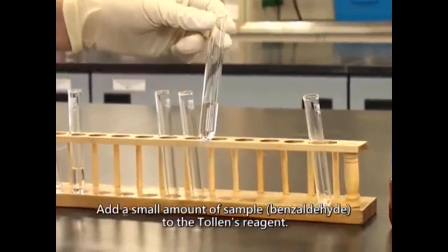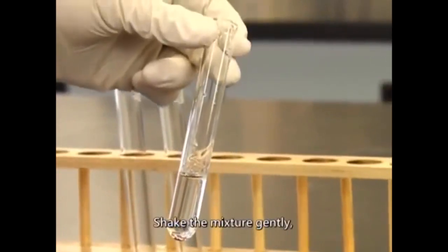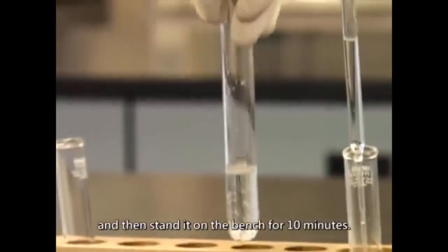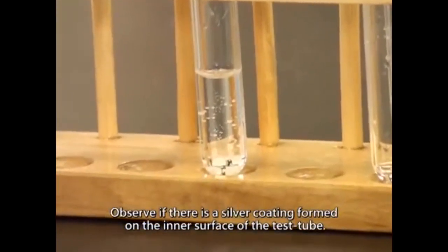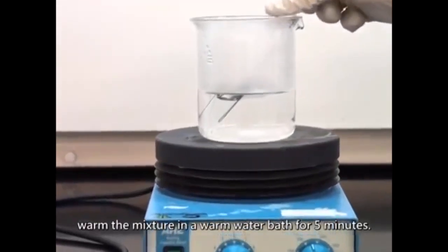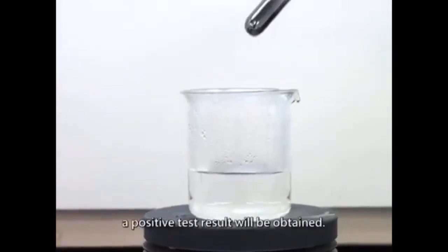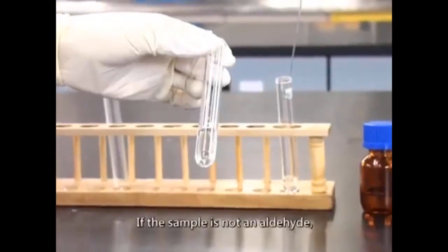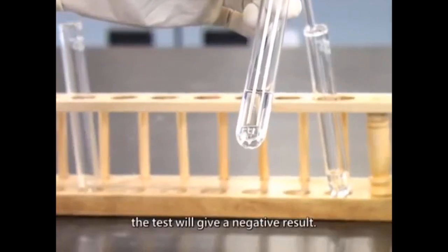Add a small amount of sample to the Tollen's reagent. Shake the mixture gently, and then stand it on the bench for 10 minutes. Observe if there is a silver coating formed on the inner surface of the test tube. If there is no observable change, warm the mixture in a warm water bath for 5 minutes. If the sample is an aldehyde, a positive test result will be obtained. If the sample is not an aldehyde, the test will give a negative result.